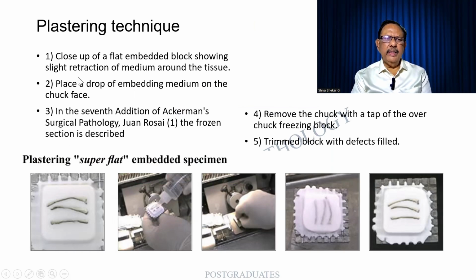Plastering technique. Sometimes you find that there can be material that has to be removed, so there can be retraction, etc. And then this is made up by means of the embedding medium. So there is a super flat embedded specimen over there. And it can be fixed again by means of other substances so that when I take a section, it has to be perfectly flat. I have to get representation of the entire tissue.